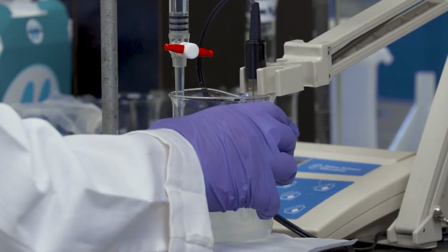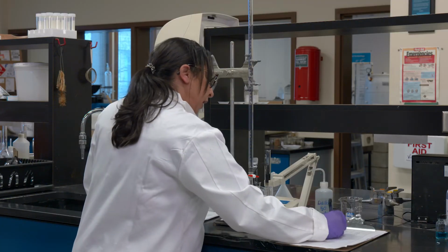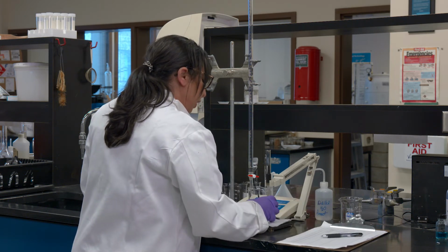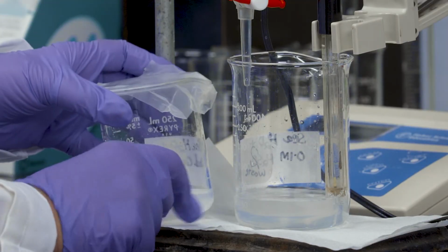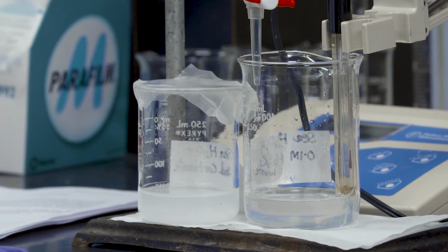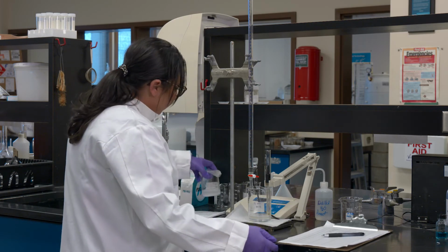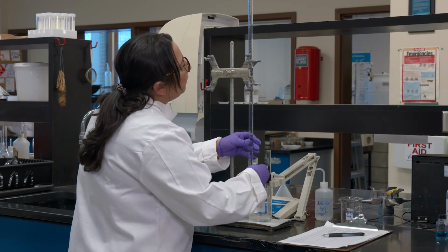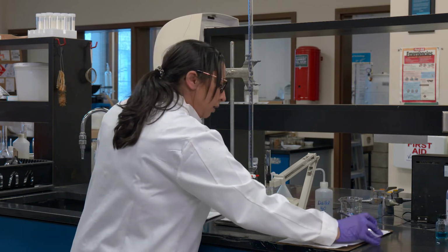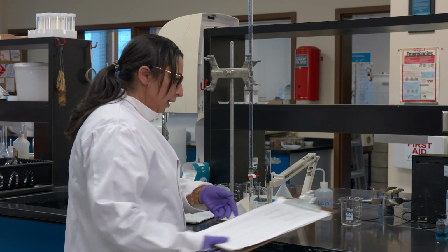Okay, so another mil. It looks like, you know what, I'm anticipating I'm going to reach my equivalence point soon, because I see a great change in the color here, the way the solution looks from the last time I showed you. So we are reaching our first equivalence point soon. I'm at pH 9, and I have 11 mils of acid added so far. So we continue doing this. And don't forget to take note of your readings.